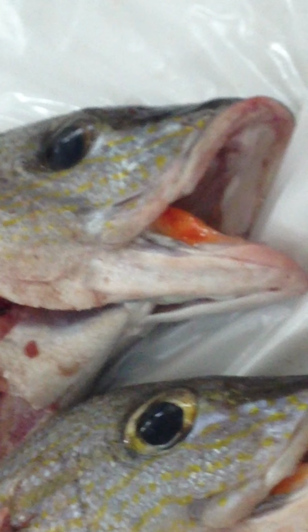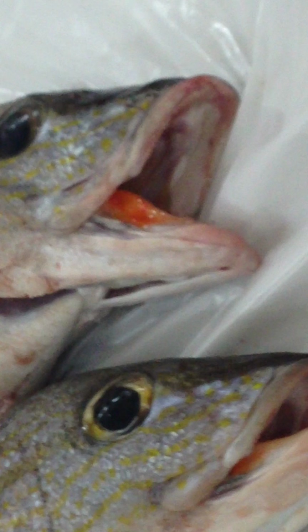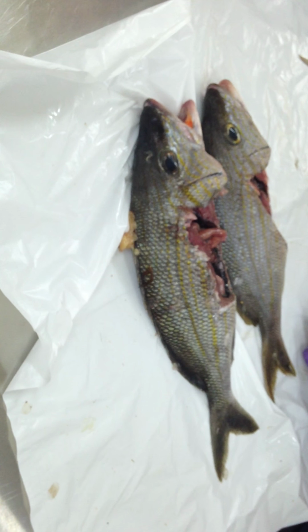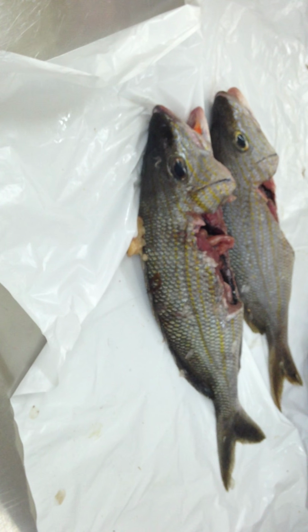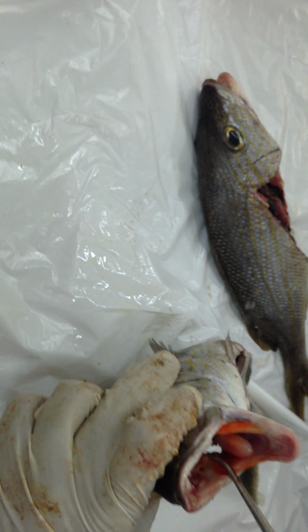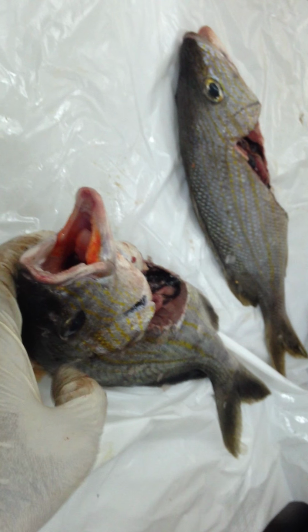Now, one important sense organ of the fish is the lateral line. You can see some dark pigmentation here. That is the lateral line, and it is the important sense organ that determines the water current, water pressure, water temperature, as well as the presence of other organisms and other fish in the surroundings. In the oral cavity, we see the maxillary teeth, mandibular teeth, the tongue, and the pharyngeal teeth.